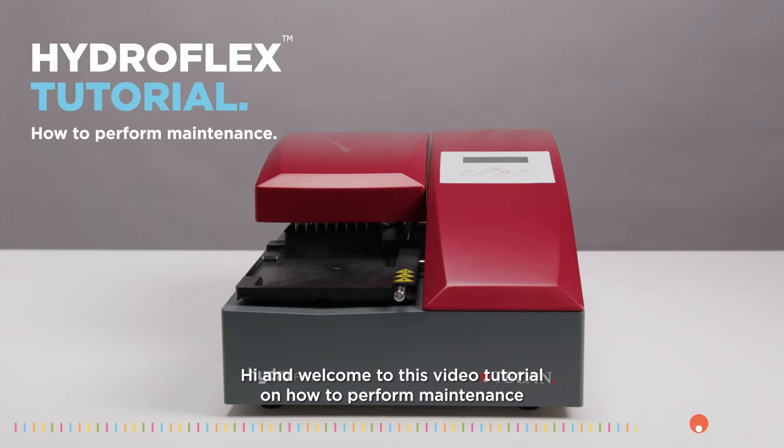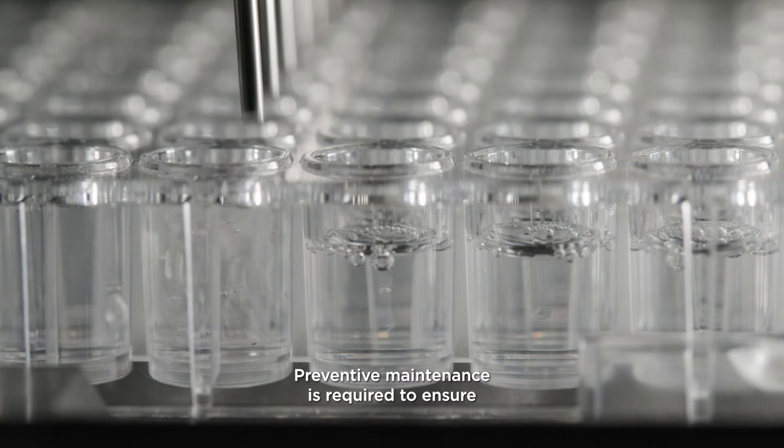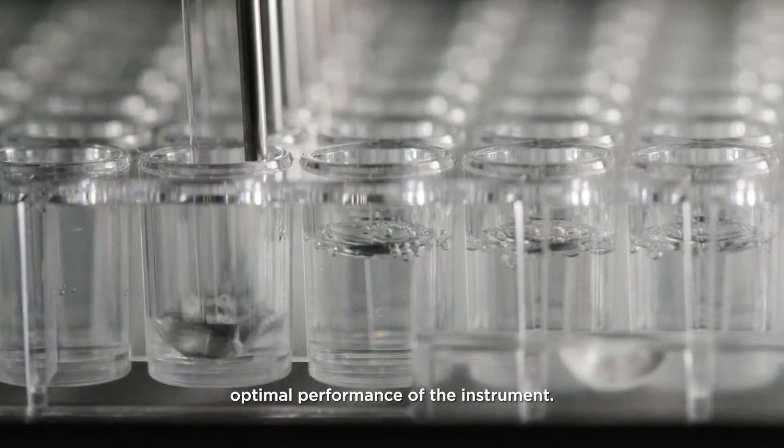Hi and welcome to this video tutorial on how to perform maintenance tasks for the HydroFlex microplate washer. Preventative maintenance is required to ensure optimal performance of the instrument.